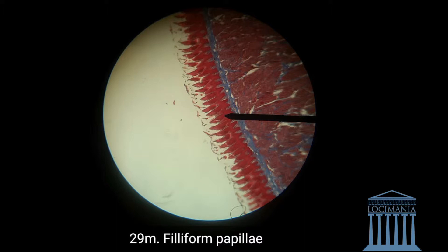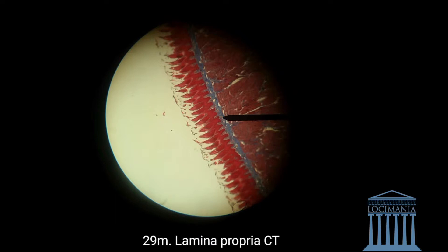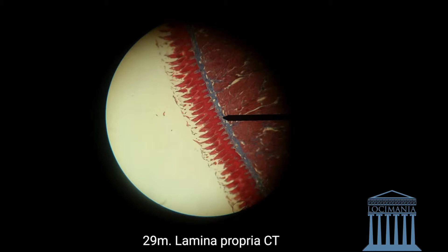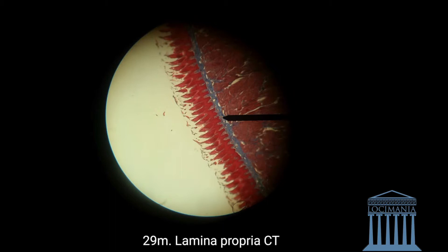I'm going to show you another specimen with the connective tissue. Here we can see the connective tissue, also called the lamina propria. It is the base of the filiform papillae. The connective tissue is really easy to see — the blue part is the connective tissue of the filiform papillae.